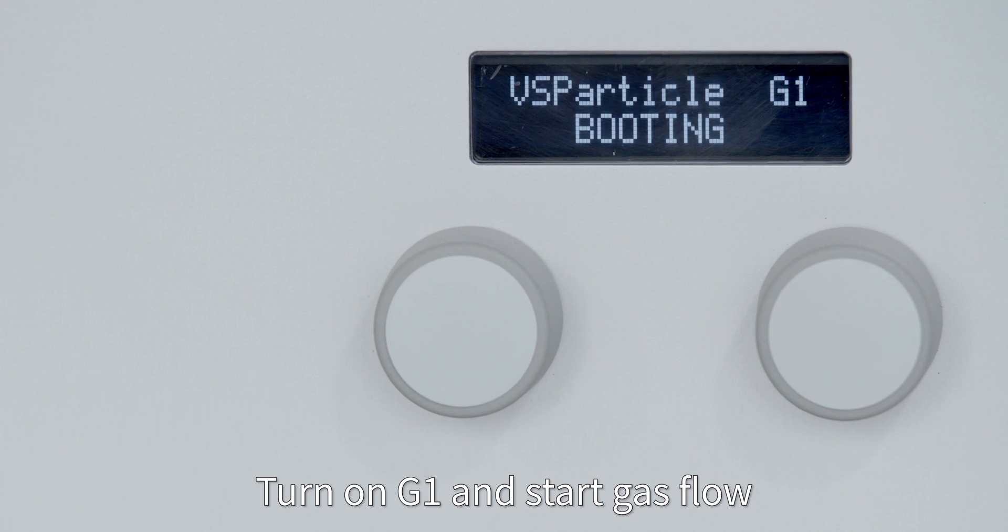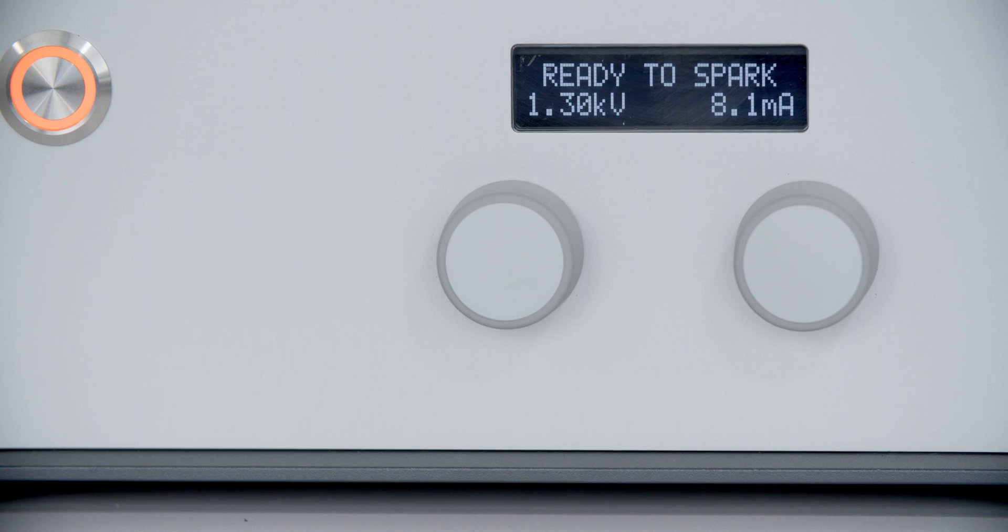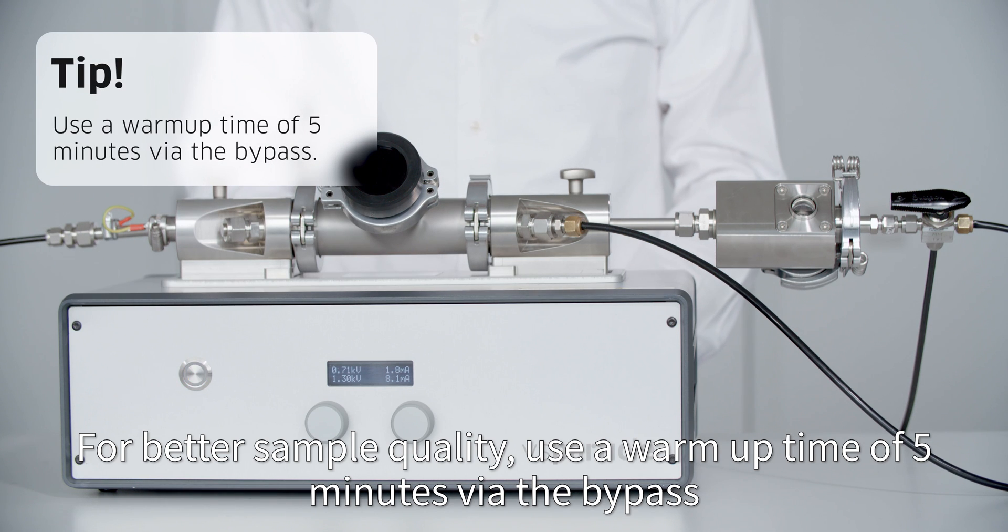Turn on G1 and start gas flow. For better sample quality, use a warm-up time of 5 minutes via the bypass.